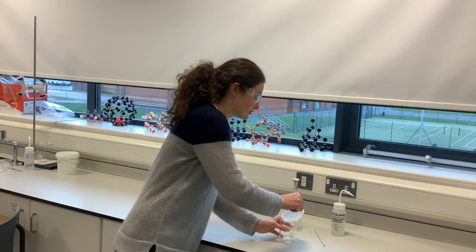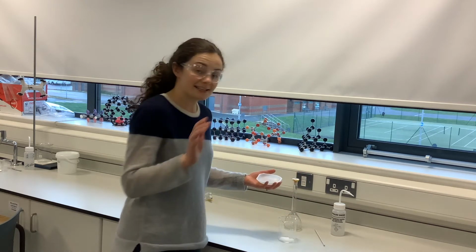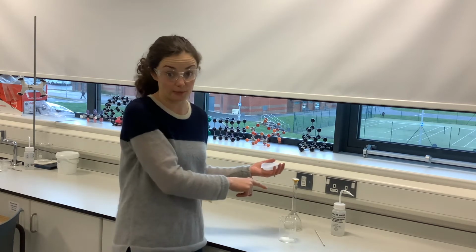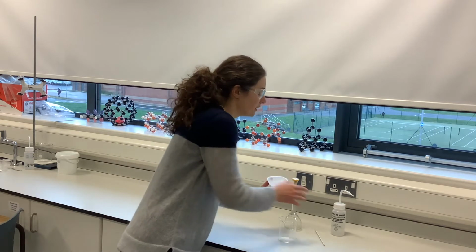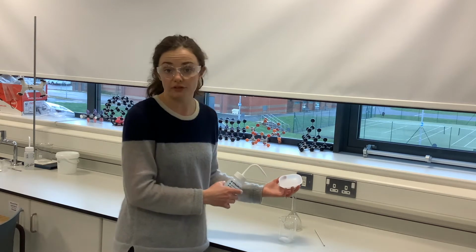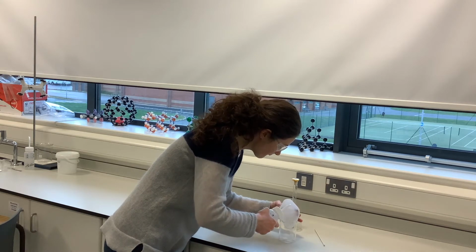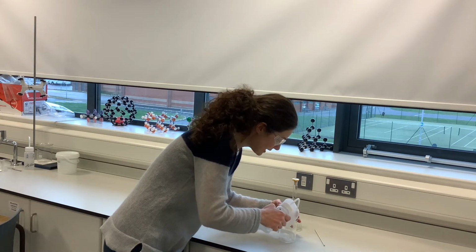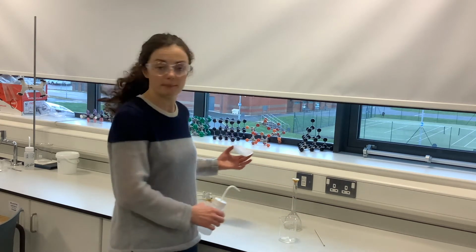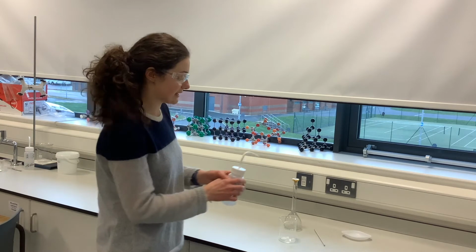So first things first, I'm just going to pour this in to my beaker, okay? But as I said, I need to make sure all of that 2.86 grams makes its way into the volumetric flask eventually. So what I need to do is rinse this weighing boat because there could be a little bit of the solid left behind. So I'm going to just rinse that carefully. Rinse the inside, again with my distilled water, because ultimately this distilled water is going to then make up my solution. Okay, so that has been rinsed now. I can set that aside.